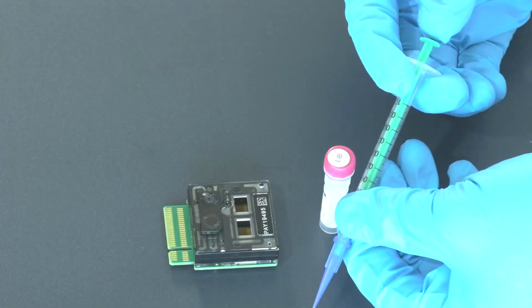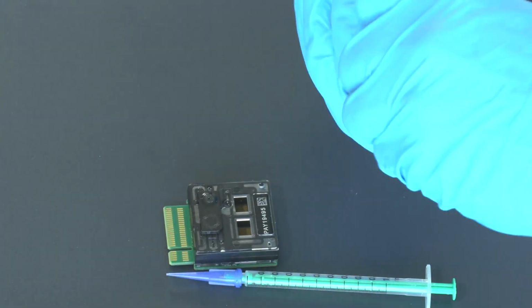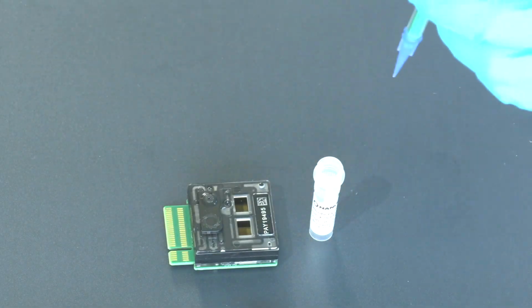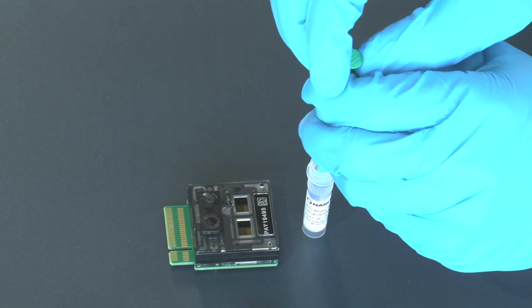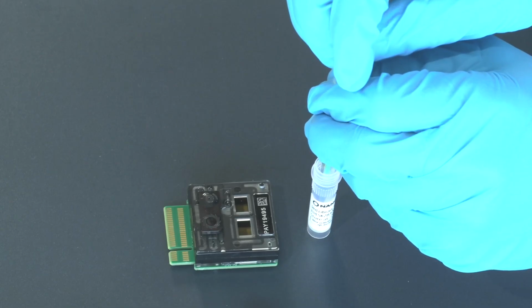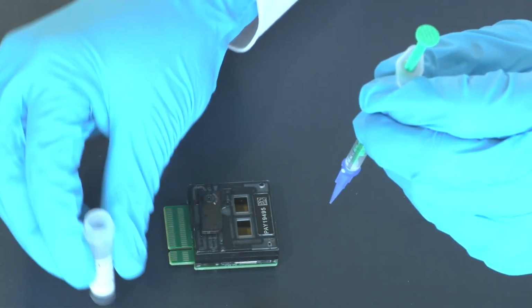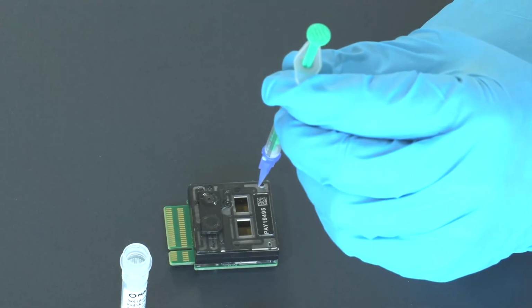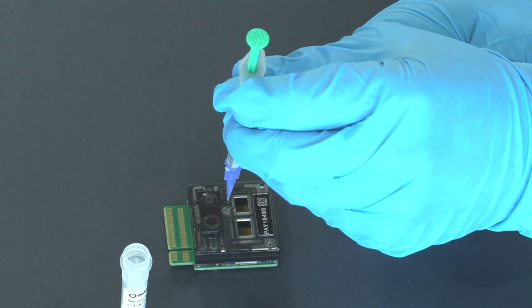So once again, I will press the plunger of the syringe to the very bottom to make sure there is nothing else in there. Open the tube with my library beads. Insert the pipette tip vertically into the tube, and this time aspirate 200 microliters, so until the 0.2 mark in the syringe, to take 200 microliters of our library into the syringe. Once again, let's check that we don't have any air inside of the tip.